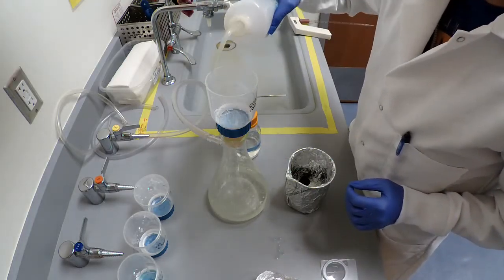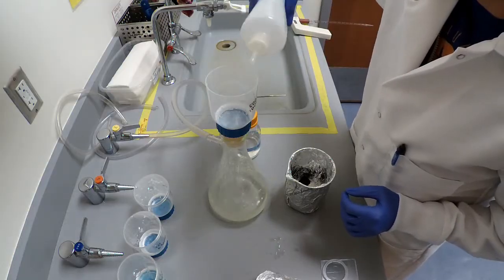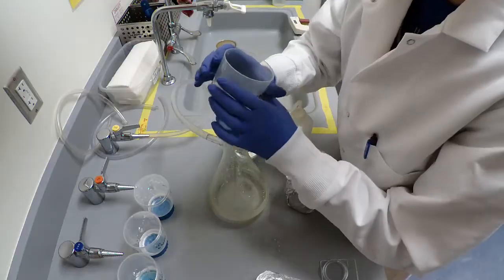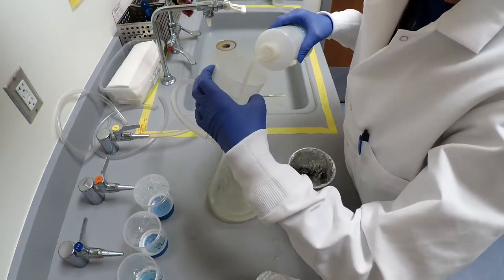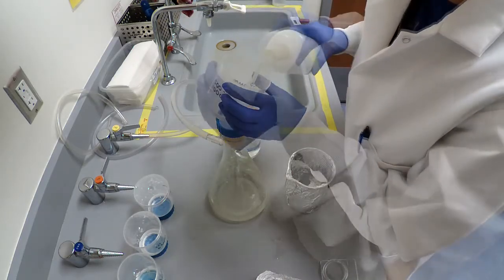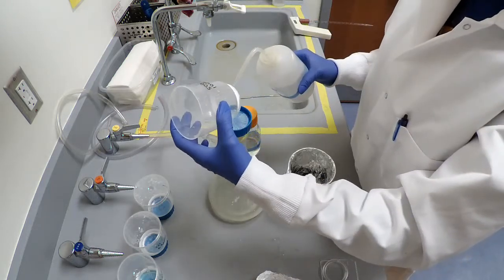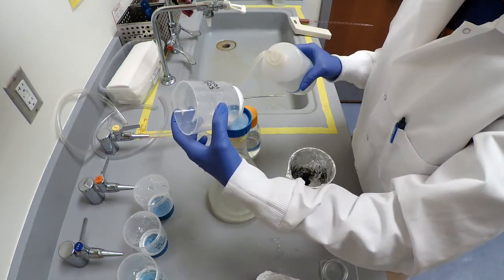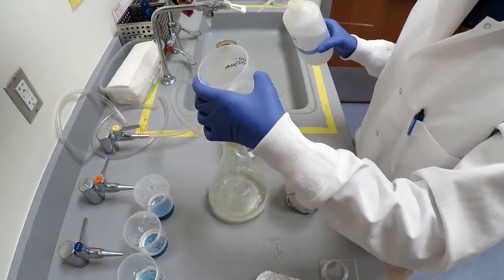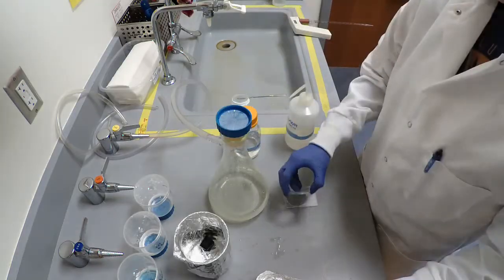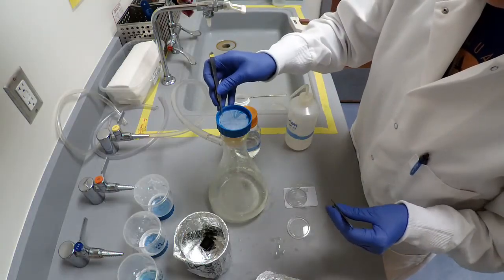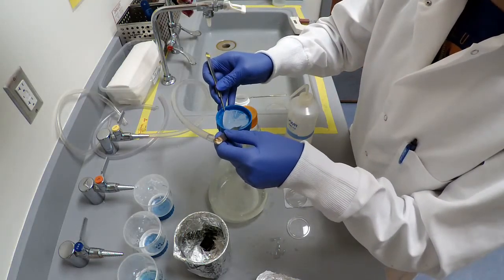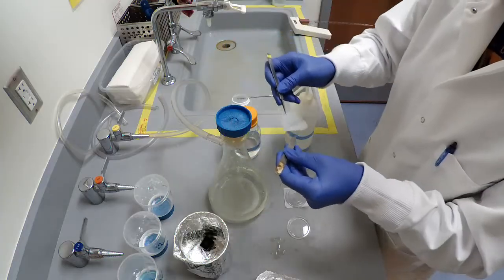Then, rinse the sides of the filtering unit with 20% 2-propanol and take off the top of the filtering unit to rinse the edges of the filtering unit onto the filter. Remove the filter and place into a foil covered petri slide for storage until evaluation with a fluorescent microscope.